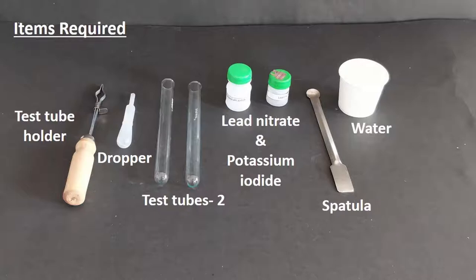For this we will need lead nitrate salt, potassium iodide salt, two test tubes, a test tube holder, spatula, water and a dropper.